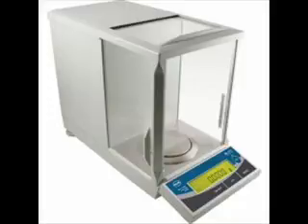You should ensure that the weighing platform on the scale is clean when you start using the scale, and that it remains clean while you take your measurements. Any materials accidentally transferred to the weighing platform could cause errors in your measurements. You should always have all of the sliding glass doors closed when taking a measurement. This eliminates air currents that could affect the measurements. The fluctuations in the balance readout can be caused by any of these items.